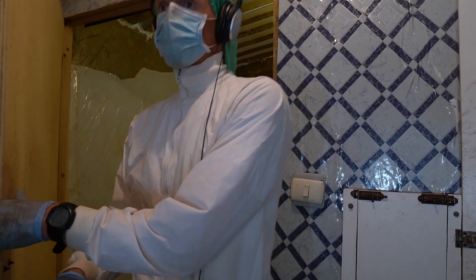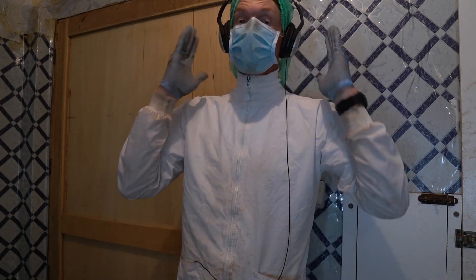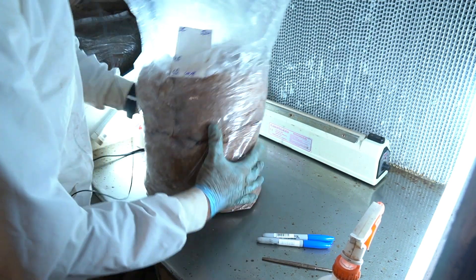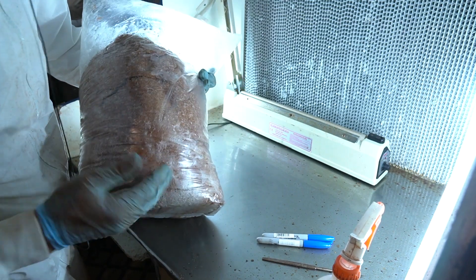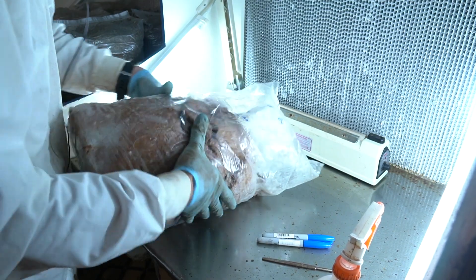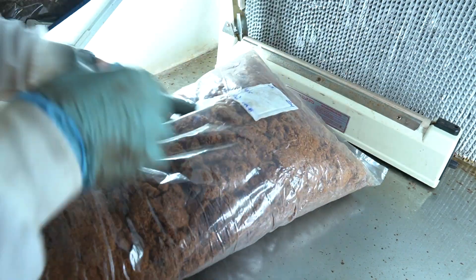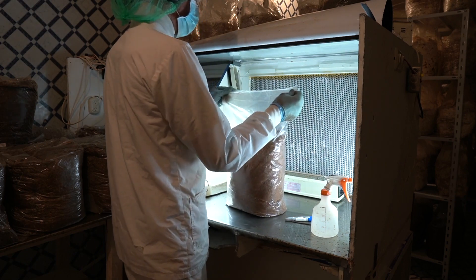These spawn blocks are all made with eucalyptus spawn, which gives them that reddish tint. Taking my vapor mask off — breathing good, feeling a lot better. First step: break this thing up. I'm able to keep these spawn blocks around for about a month. When they're just a week in they're really easy to break up — you can see nice coverage of mycelium. These are about a couple weeks in so it's a little harder. Break it up good, break it up as best you can, rotate around in the bag.